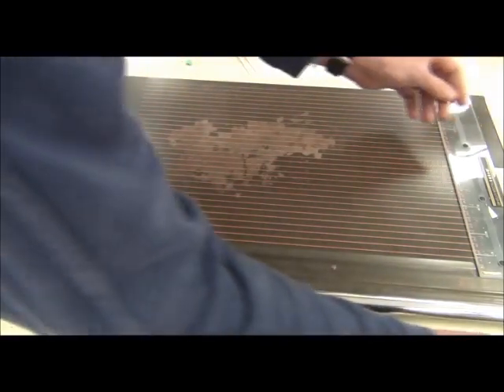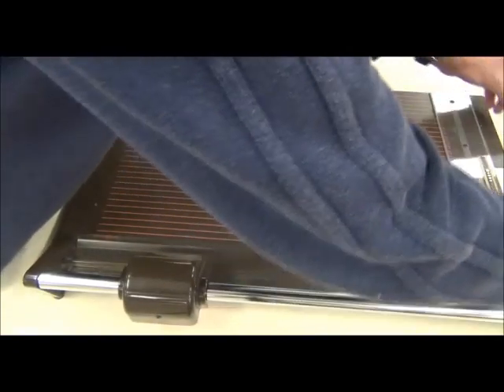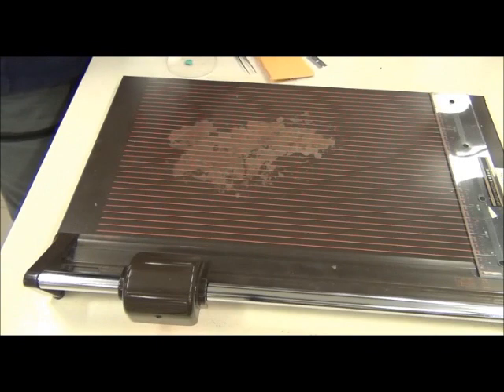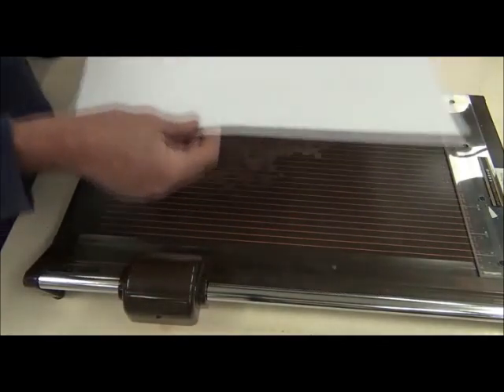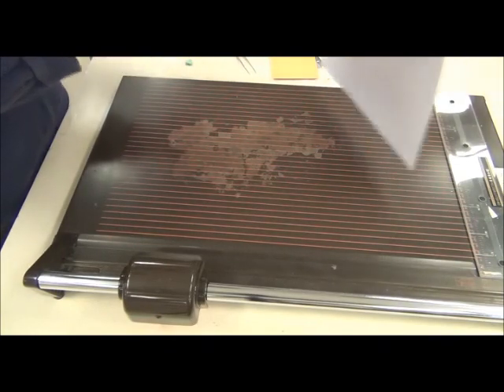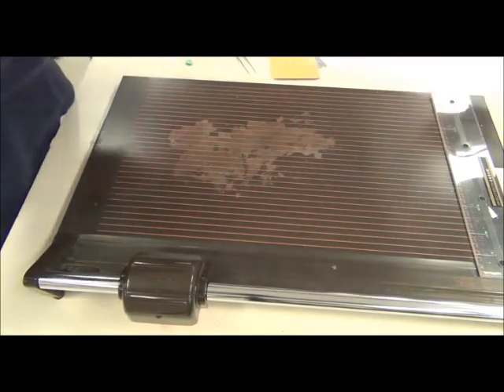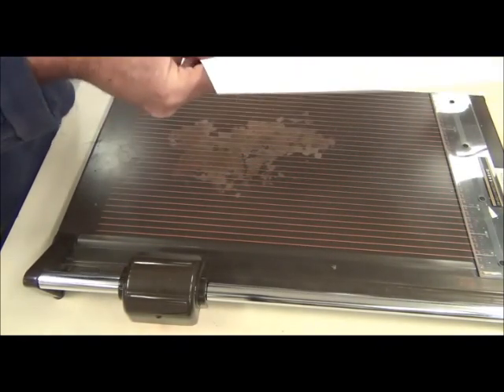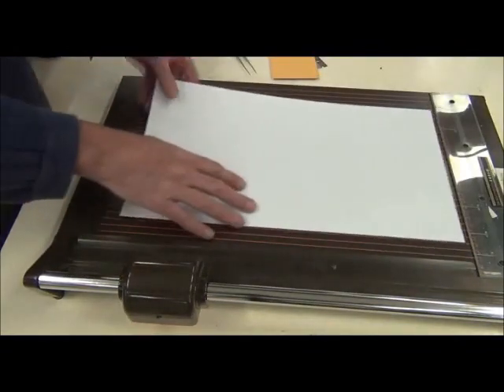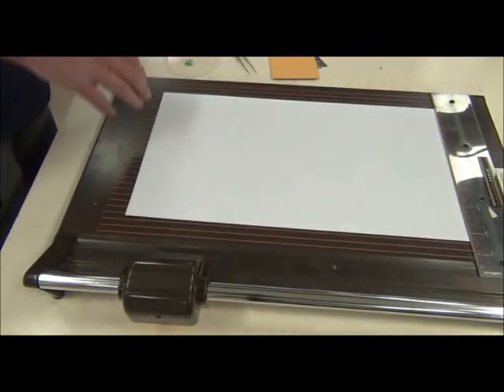But if you can avoid that, that would be good because you'll get a lot out of them. So I've got those pieces of tape and I want a card. You can see that it sort of flops one way and it holds up quite well the other way. So I'm going to mount it with the way in which it holds up a bit better by itself because that's a sort of natural thing.